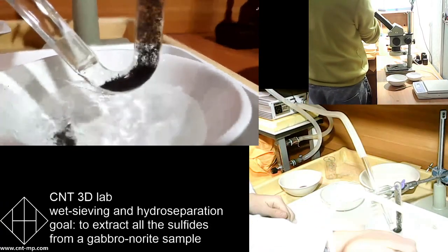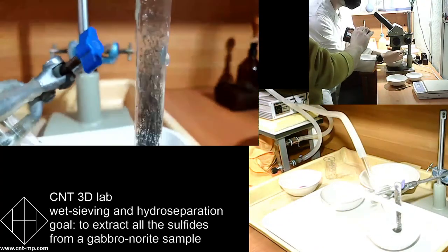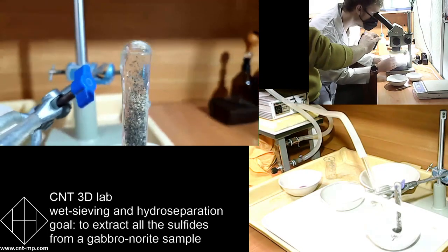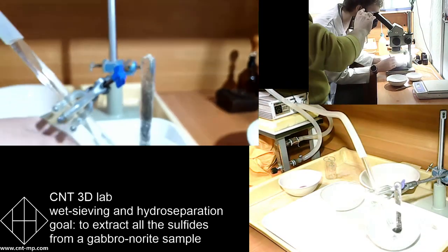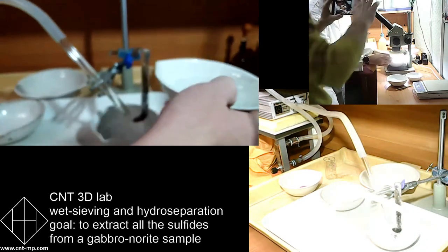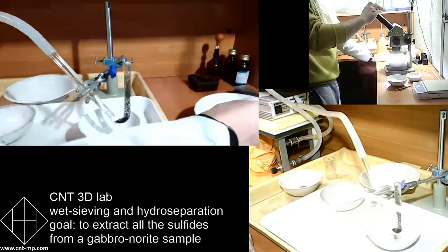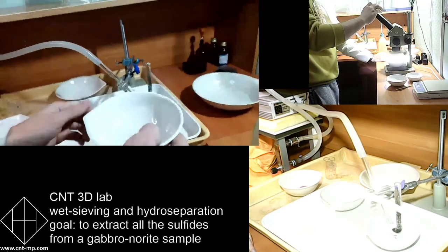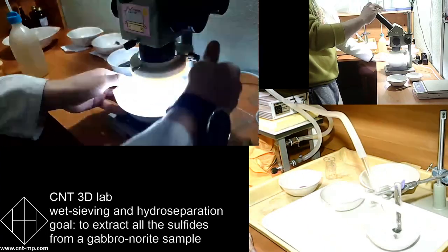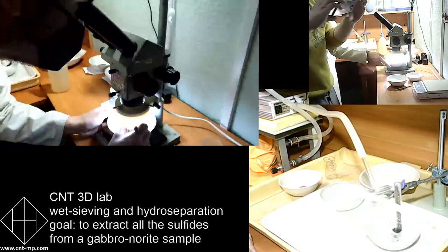You can see in the left upper frame that the hydroseparation process has started, and you can see particles jumping up and down. Some particles are led upwards out of the GST from the top, and some particles stay at the bottom. Every situation is monitored under the binocular.